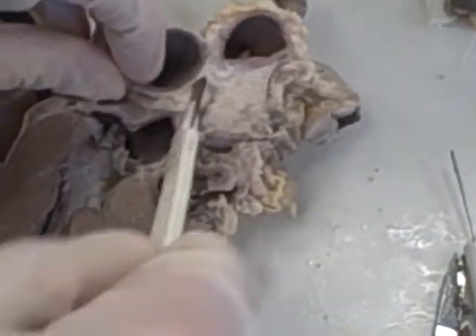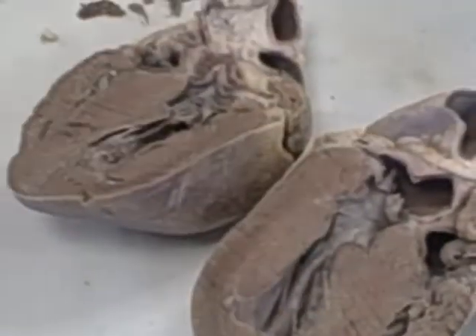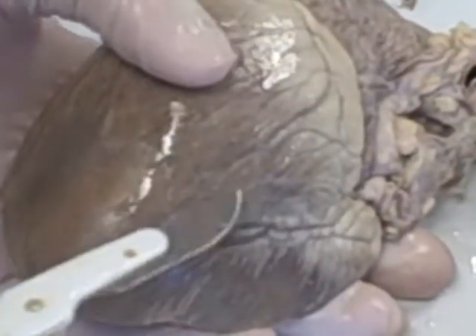There are various ventricles and arteries here. Coronary arteries — very important — running right through the side here. And on the outside wall, as you can see, very muscular again. That's one of the traits of the sheep heart.